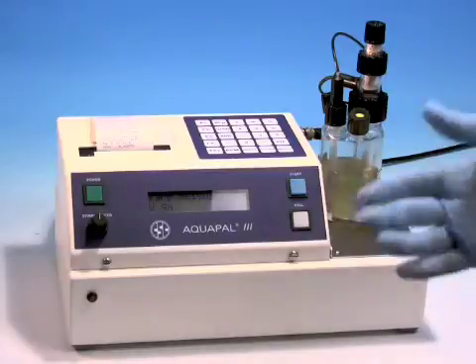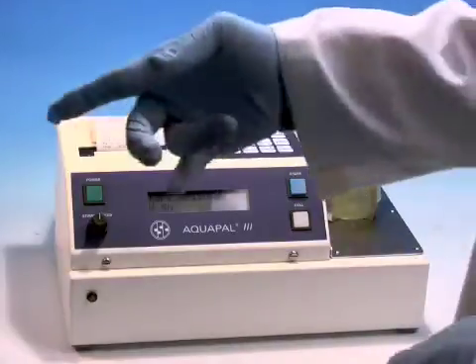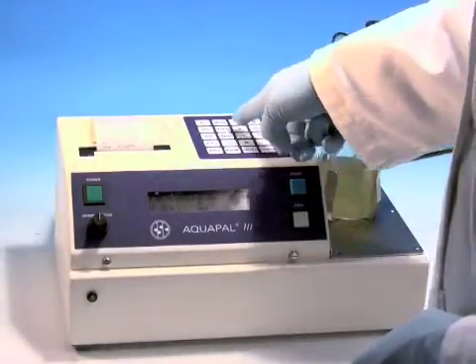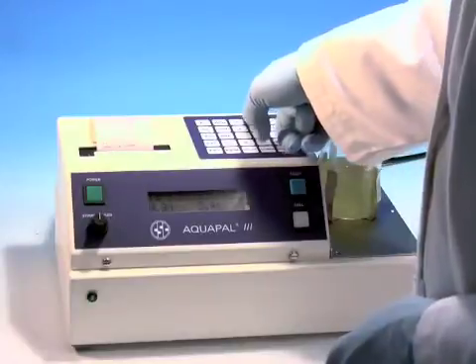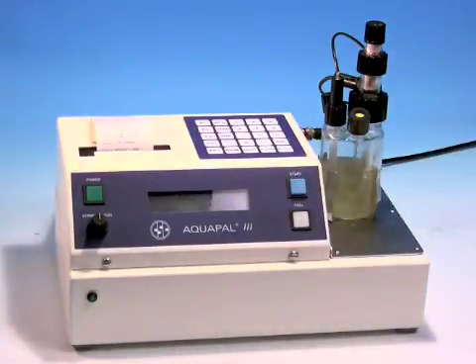Now it's measured and it wants us to put the tare weight in, which is the ending weight. I can see the balance, I'm going to put that in. And we have a result. In this case, it's 8.2 ppm.